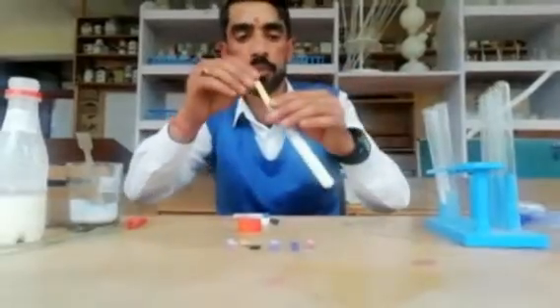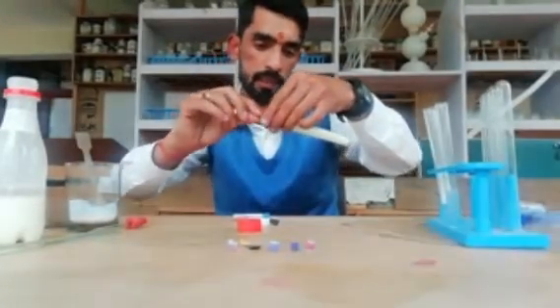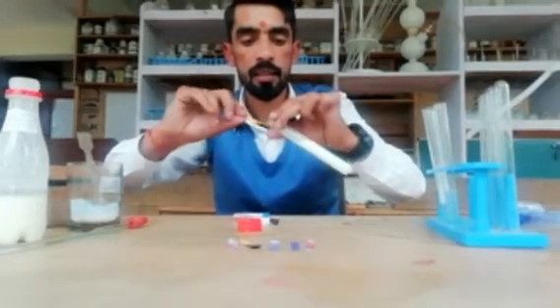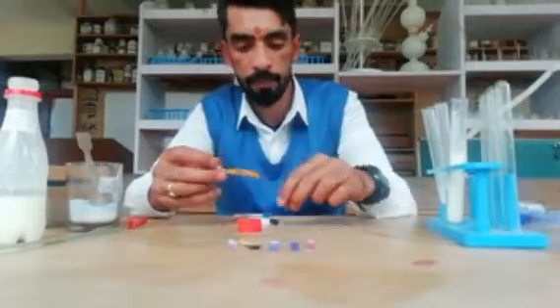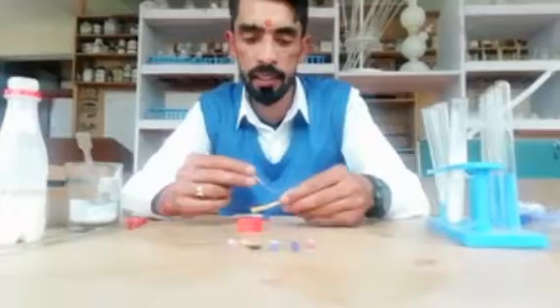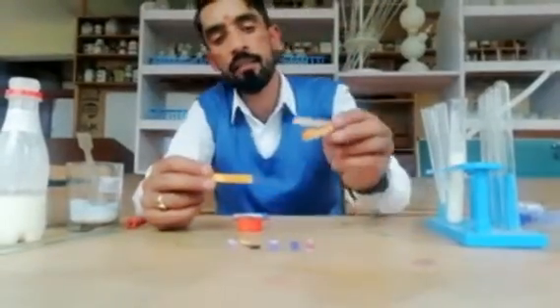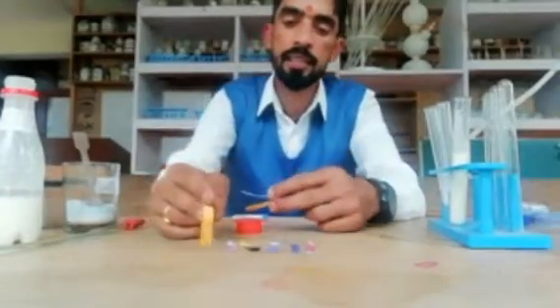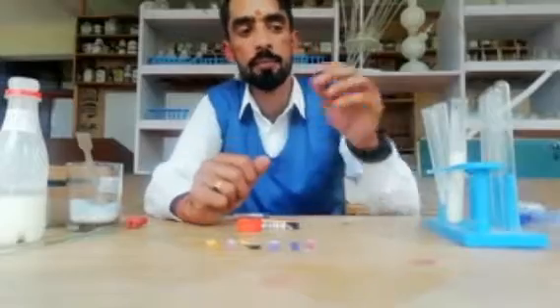Now we will use the universal pH paper. When the pH paper is dipped in curd, it changes to an orange color. The orange color value is about three, so the pH value of curd is approximately three. Since three is less than seven, it means that curd is acidic in nature. This proves that curd contains acid.